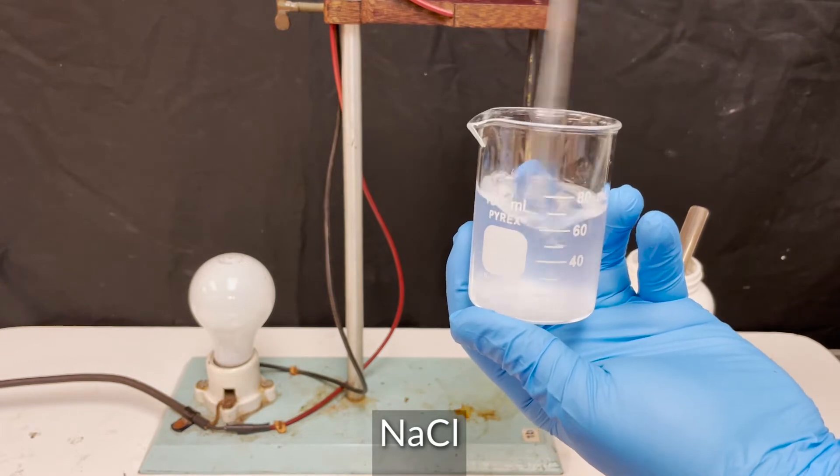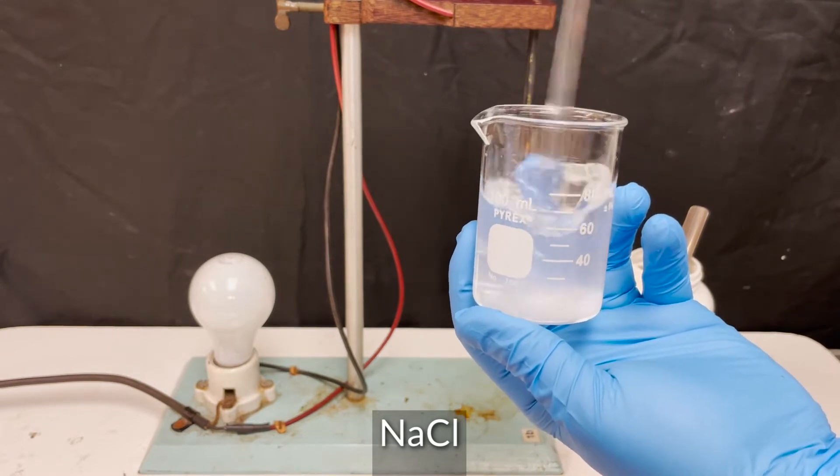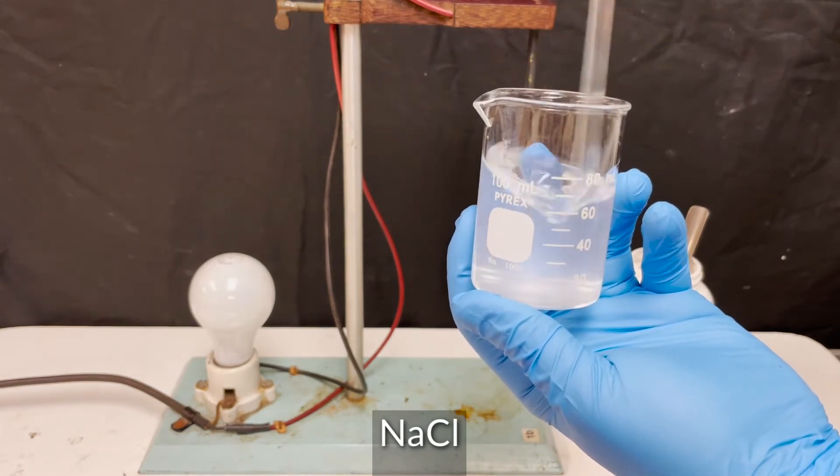Solubility rules predict that sodium chloride will be soluble in water, and when I stir it up here, we can see that it dissolves pretty easily.